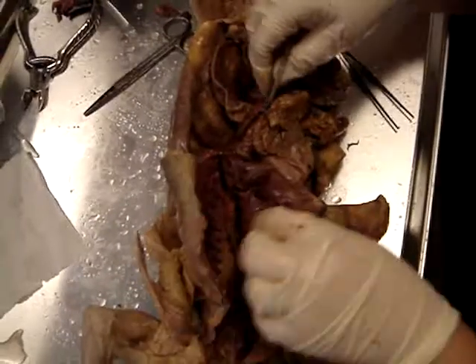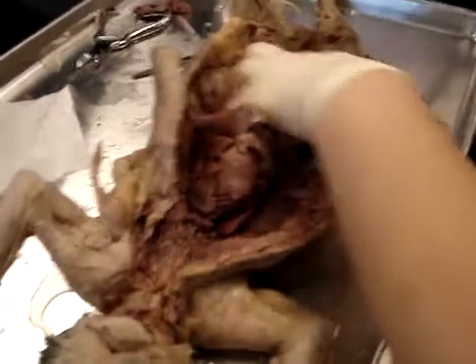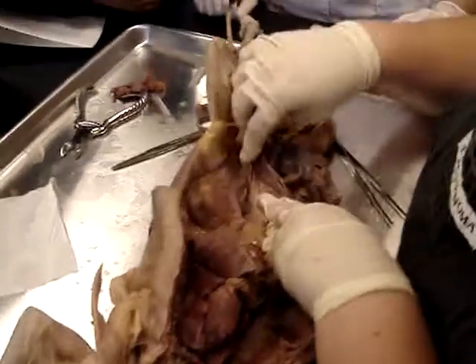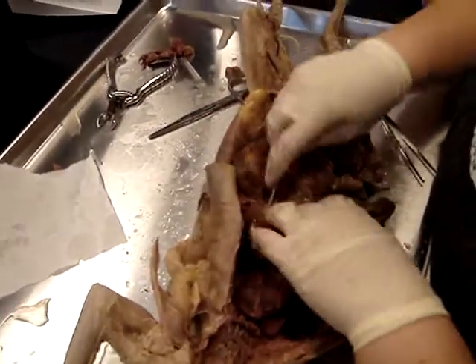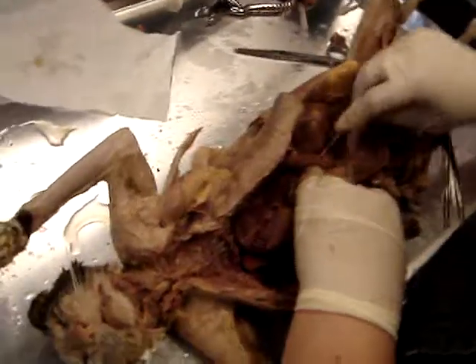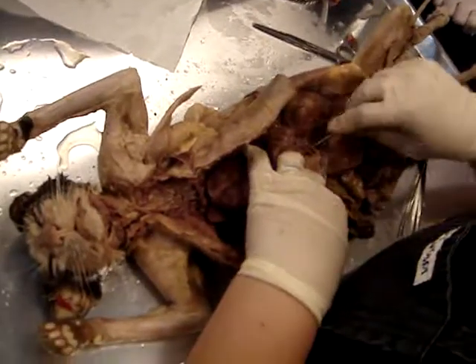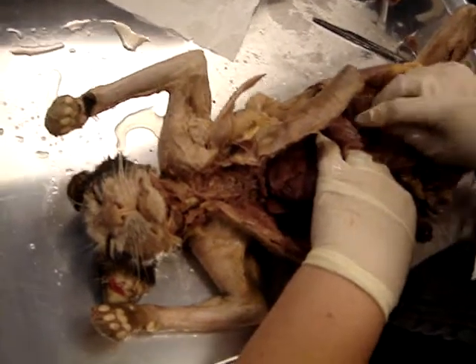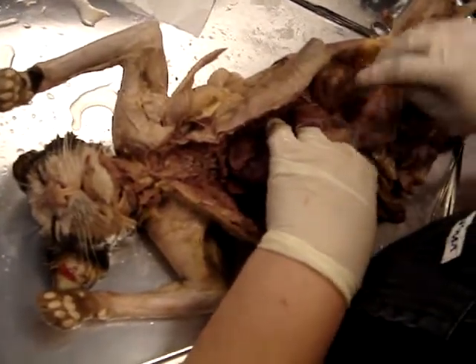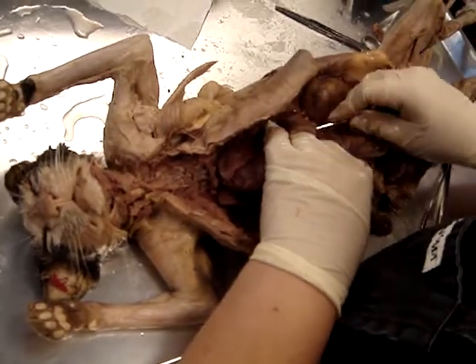Okay, so that's the thoracic aorta because it's above the diaphragm. Okay, now in the lower part, the next 2 arteries you're going to learn, you find by basically pulling your spleen and your stomach to the side and just poking around, and you're going to see these 2 fairly large single arteries that do not have a right and left side. There's just the one.